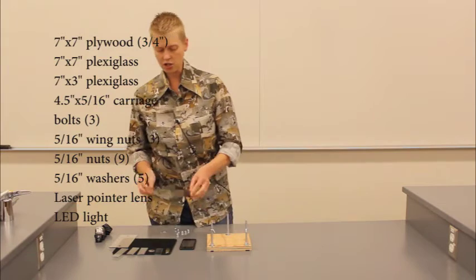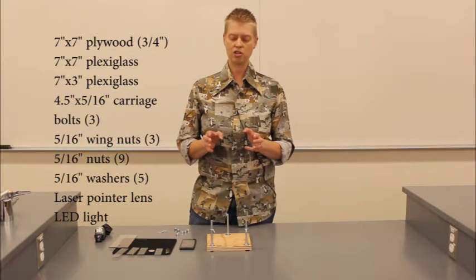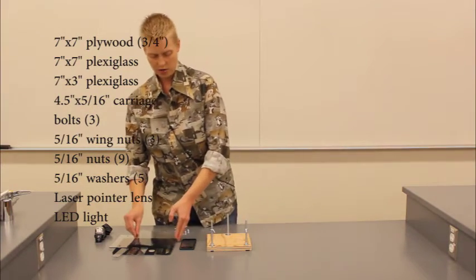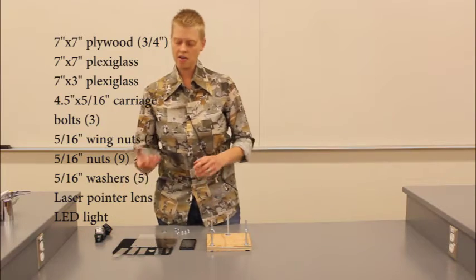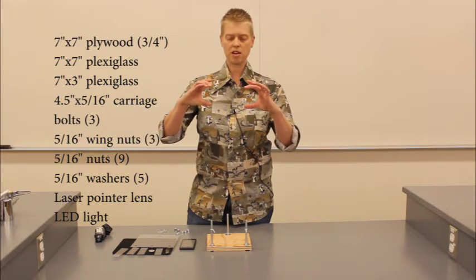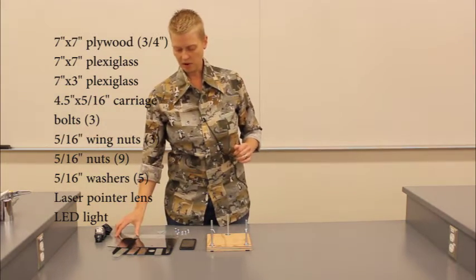You're going to need at least 2 pieces of plexiglass. One of them is going to be cut in a 7 by 7 inch square piece that is going to fit over top of your microscope stand here. The second one is going to be cut in a smaller piece. It is 7 by 3 inches, and that is going to be a specimen stand.